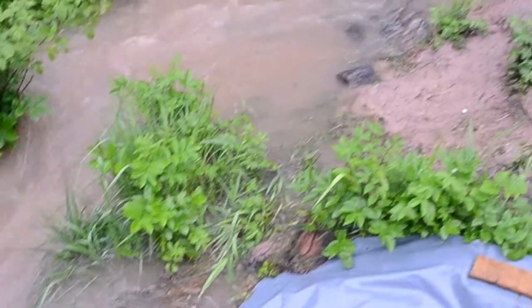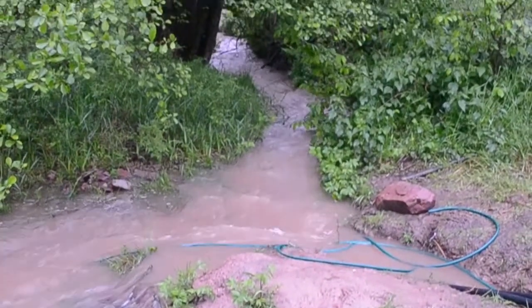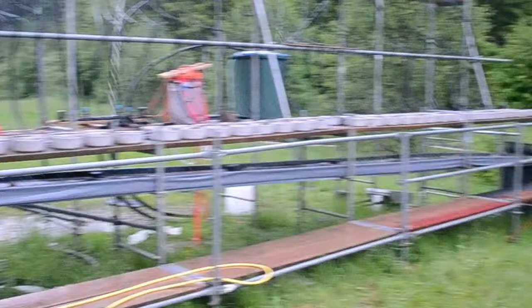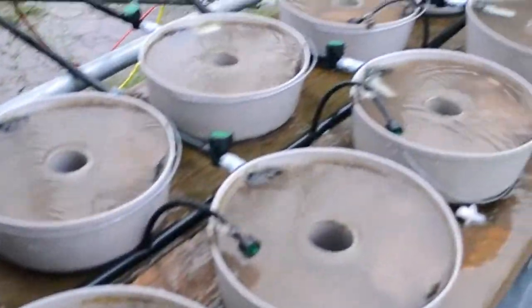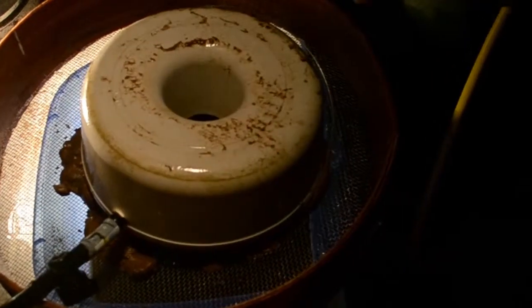Because of heavy rainfall and an upcoming flooding event, we started the final sampling of the channels at night. With the final sampling, we collect all the macroinvertebrates we find in the channels after a 5-week experimental period. We disconnect the channel from the water supply and transfer the complete contents of the channel into a tub. On top of the tub is a sieve with a 4 mm mesh size to retain all the big rocks.